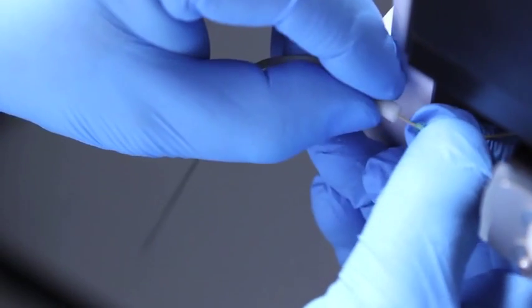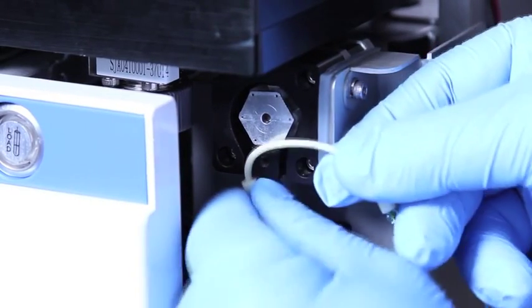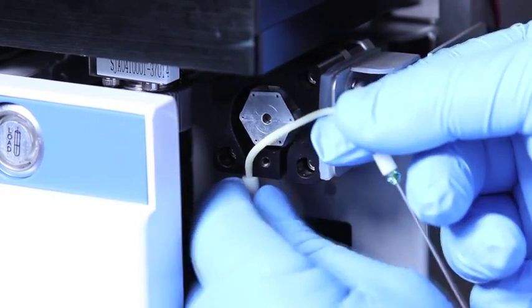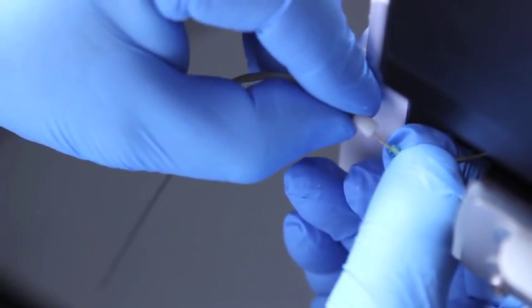Remove the sample probe from the sample probe station. To install the new sample tubing, place the new sample probe in the sample probe station. Reinsert the sample line into the line from the flow cell.